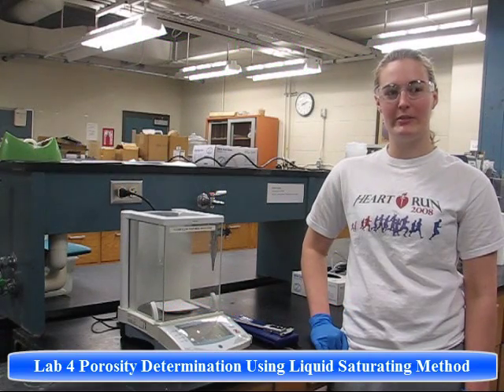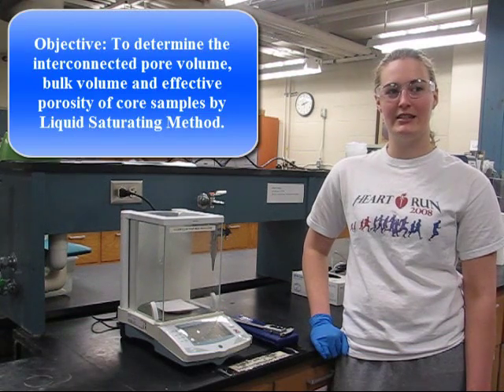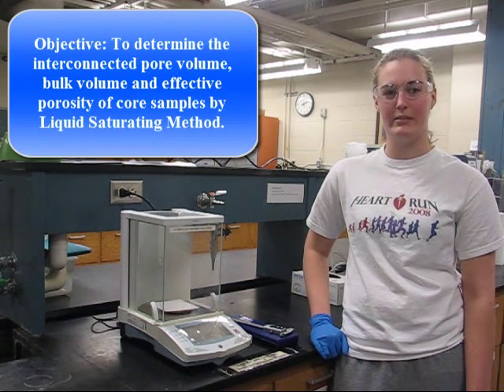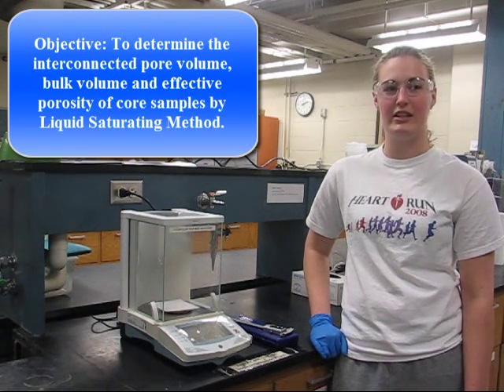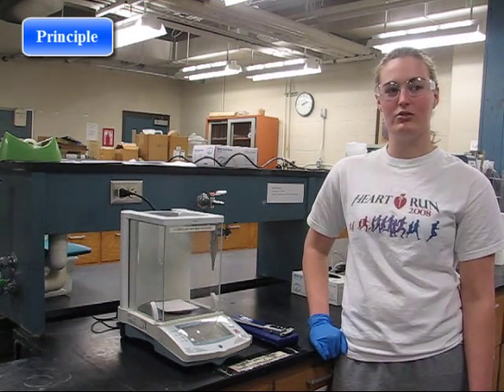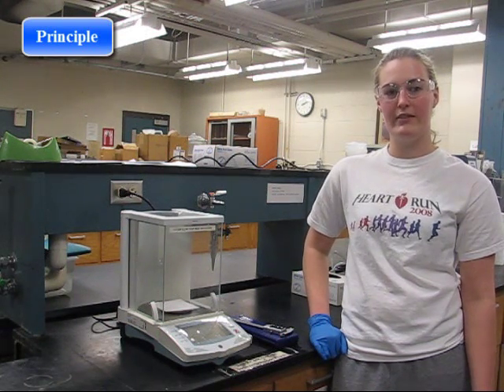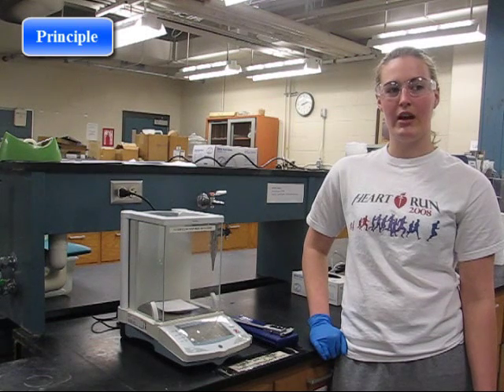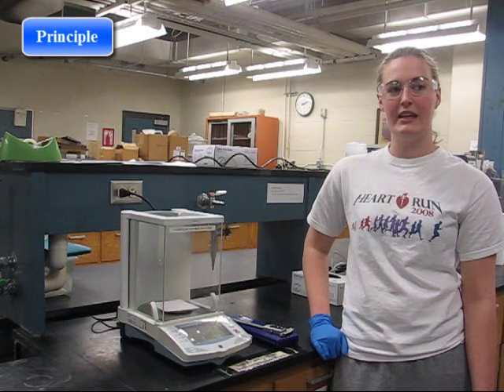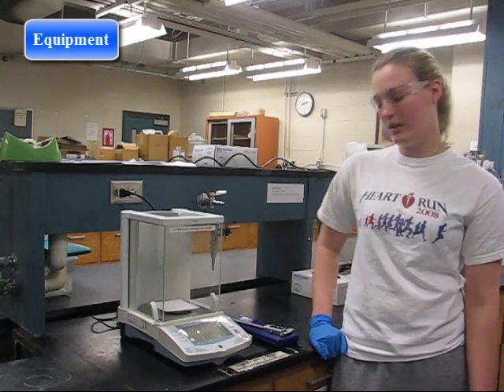Titled: Porosity Determination Using the Liquid Saturation Method. Our objective today is to determine the interconnected pore volume, bulk volume, and effective porosity of a core sample using the liquid saturation method. A fluid of known density is introduced into a dry core sample that is then vacuumed. The difference between the weight of the saturated sample and the dry weight of the sample is the fluid weight that filled the pore space. If the density of the introduced fluid is known, then we can determine the pore volume.